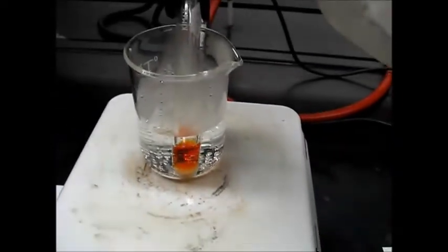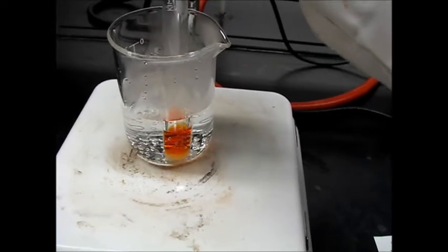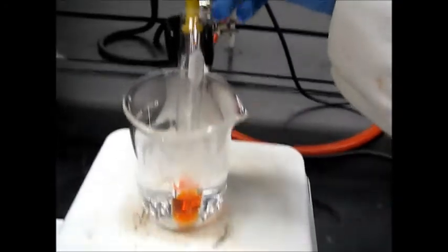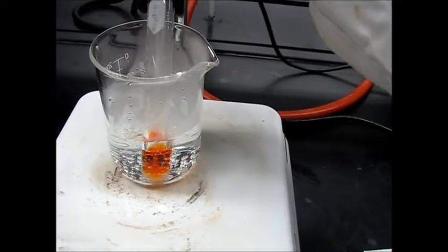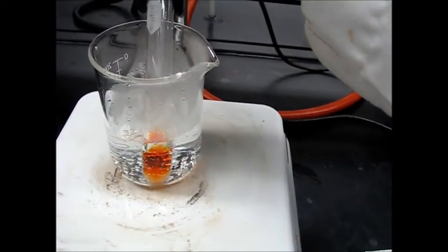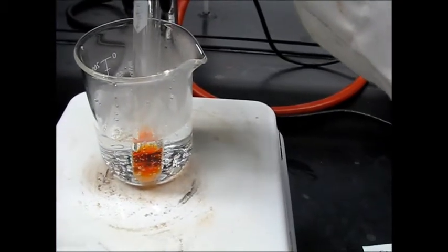And we can do one thing, that you can just stir using a rubber, this pipette, glass pipette. Gently, just do not do anything.